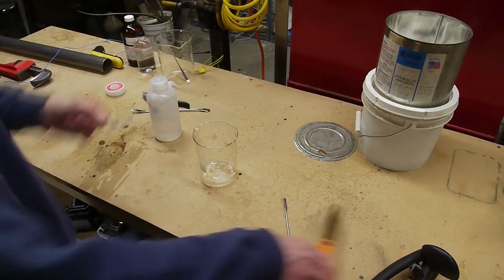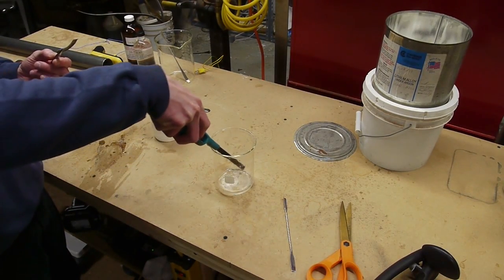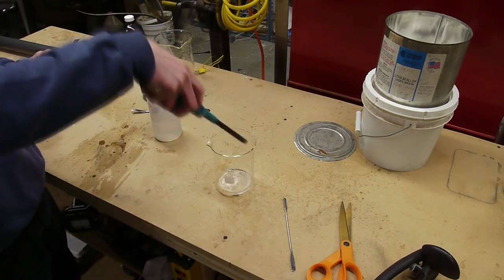It's a very soft metal. And as we can see, classic vigorous reaction there. You can see the hydrogen bursting.